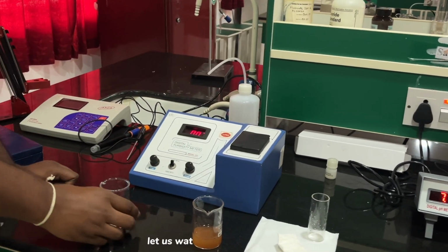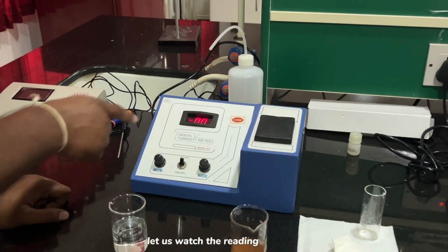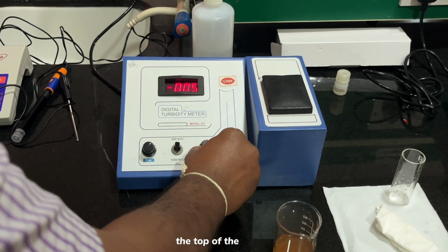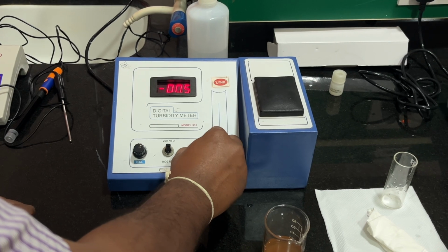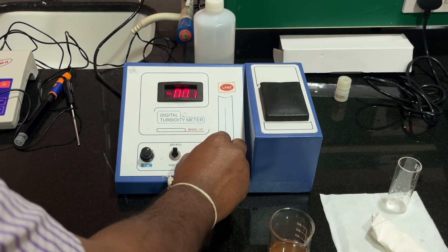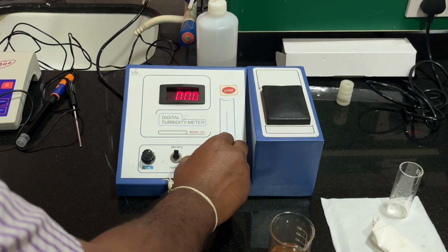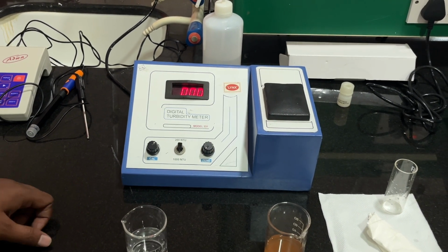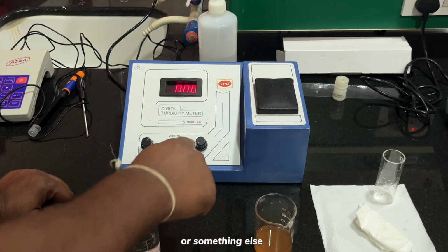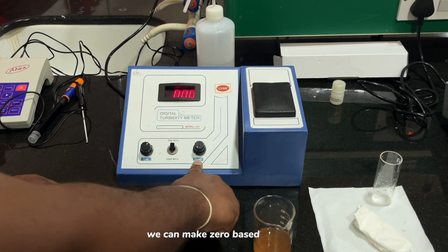Let us watch the reading. You see, the turbidity shows around 0. If it does not show 0, or shows minus 0 or something else, we can set it to 0 based on this calibration.